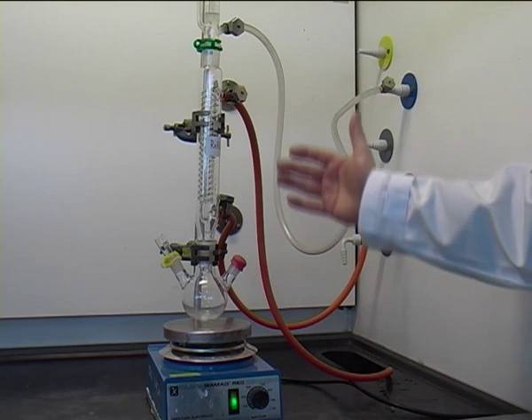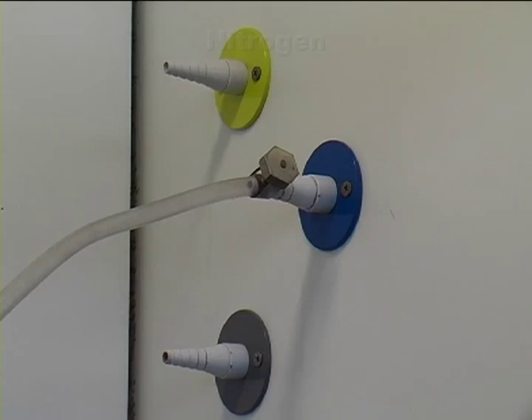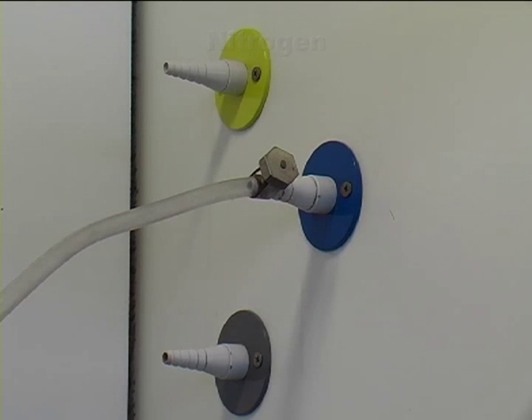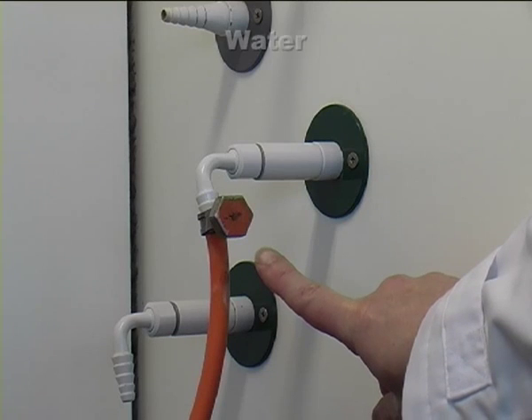Here we see the setup in the fume cupboard, how it will look like when you do it actually. That's our nitrogen inlet with the blue color. Again, we seal it with the jubilee clip to make sure that it doesn't fall off.